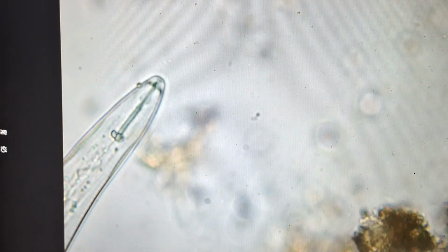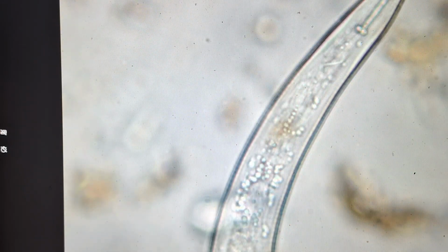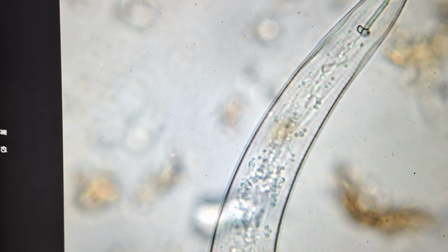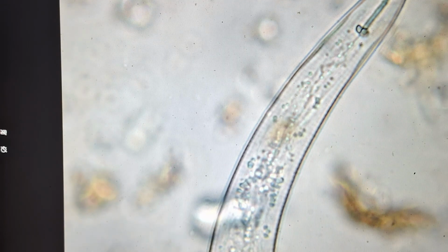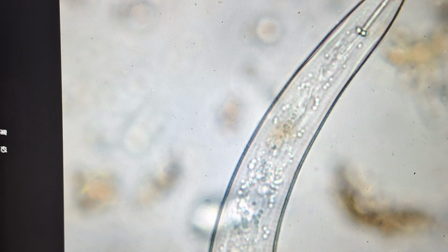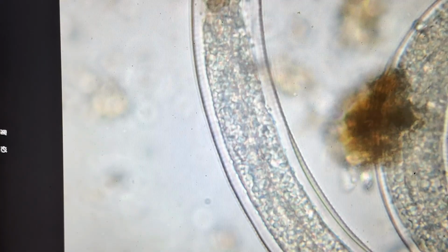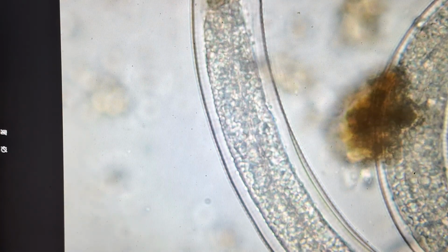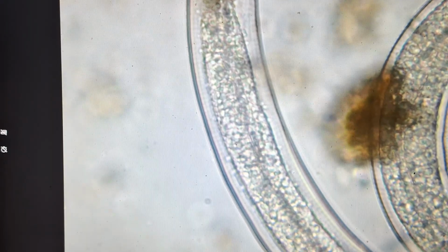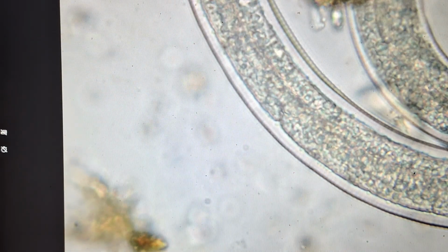Let's take a better look at this nematode. We'll look down its whole body. Even inside of this nematode, we can see the bacteria that it's already consumed. I get a kick out of being able to see even the ribs on it. You can see, just like an earthworm, it's a worm. It's a microscopic worm, but it's a worm. So when we talk about worm castings, they're very bacterial in nature. We'll find fungi in there, but the inside of them is generally the same as the inside of this nematode, bacterial dominated.